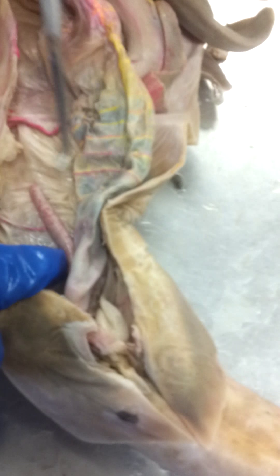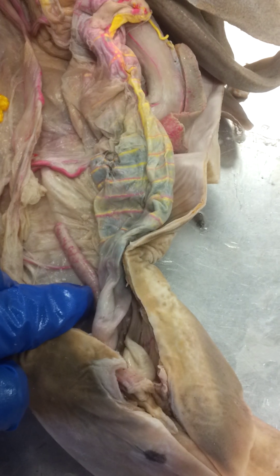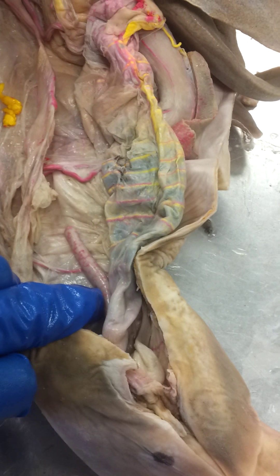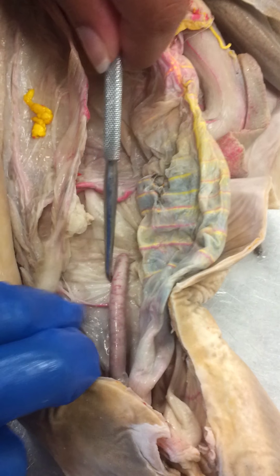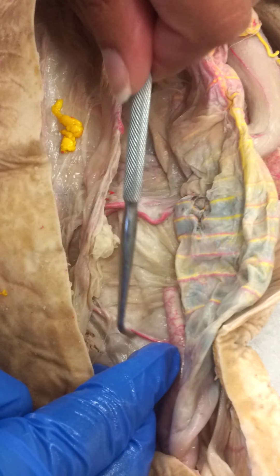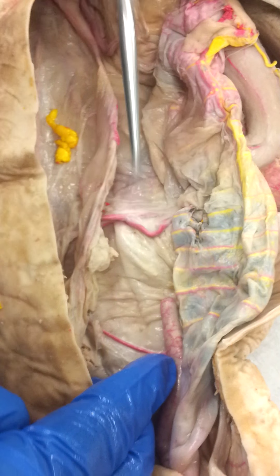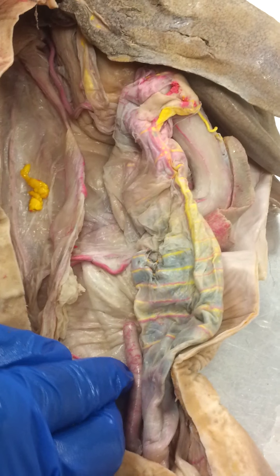Over here is your rectal gland. From your rectal gland, you have your posterior mesenteric artery, which is right here — that red strip right there. That's your posterior mesenteric artery.